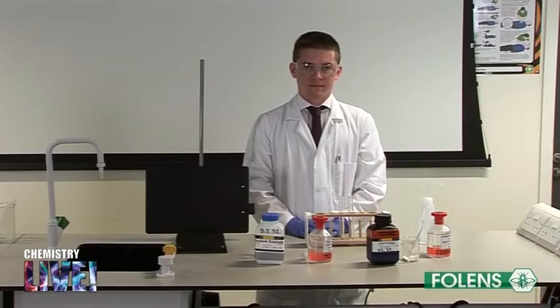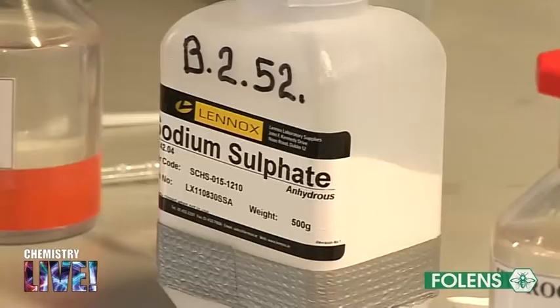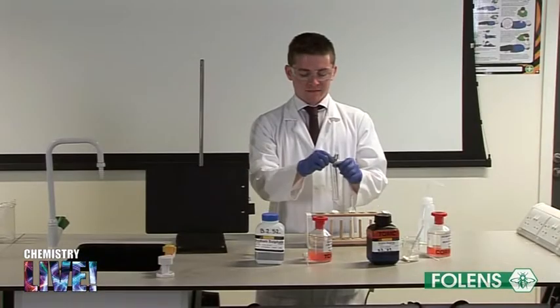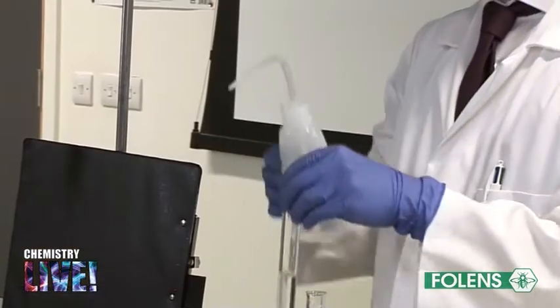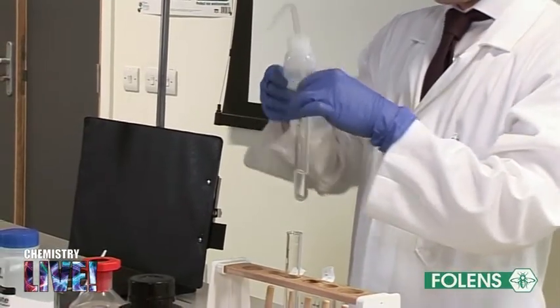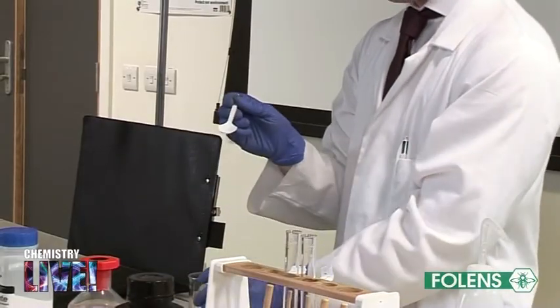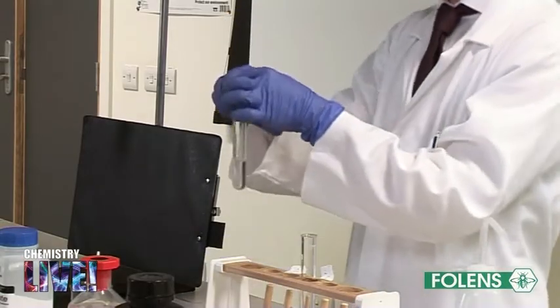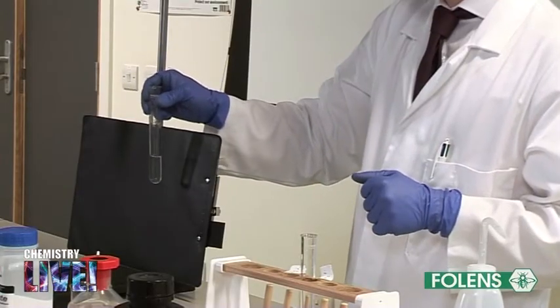Experiment to detect the presence of sulfate ions, SO42-, and sulfite ions, SO32-, in aqueous solution. Using a wash bottle of deionized water, fill two test tubes to about one quarter of their capacity with deionized water. Add a small amount of the sulfate salt to the water in one test tube. Shake the test tube to help the salt dissolve. A clear solution should be obtained.